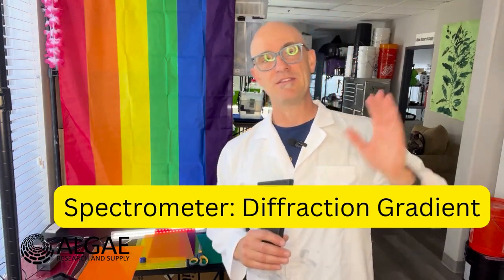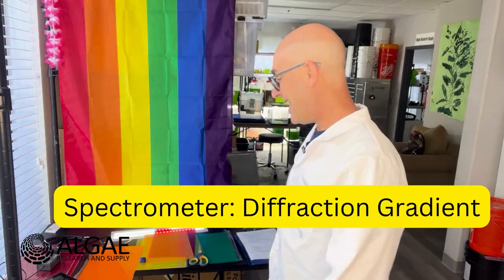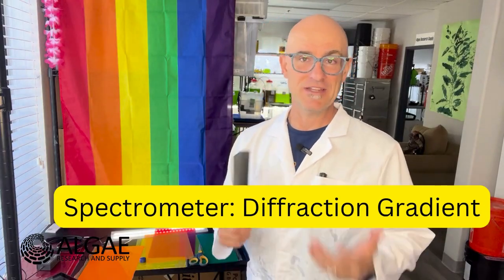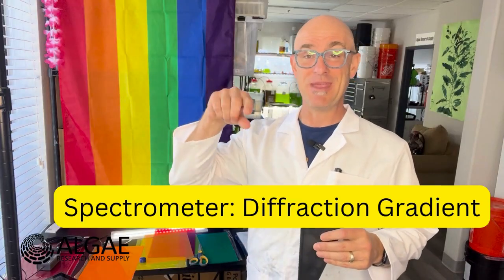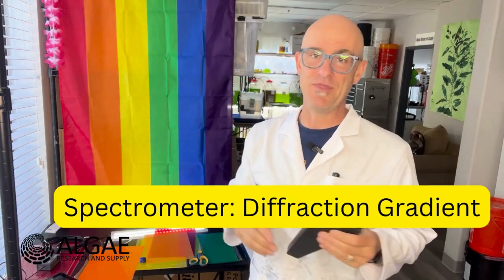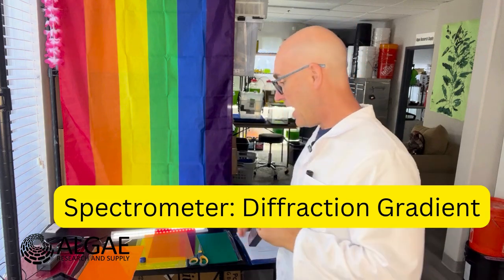And we're going to compare that to the sunlight outside. And I think we're going to be able to use some AI software, mainly a ChatGPT program, to be able to look at that spectrum and to be able to actually make some graphs with it. At least we're going to give that a try.